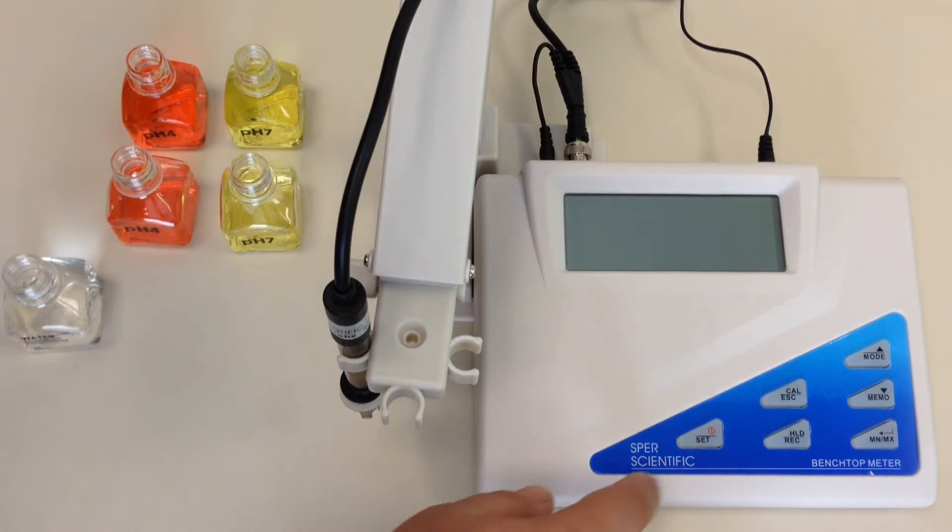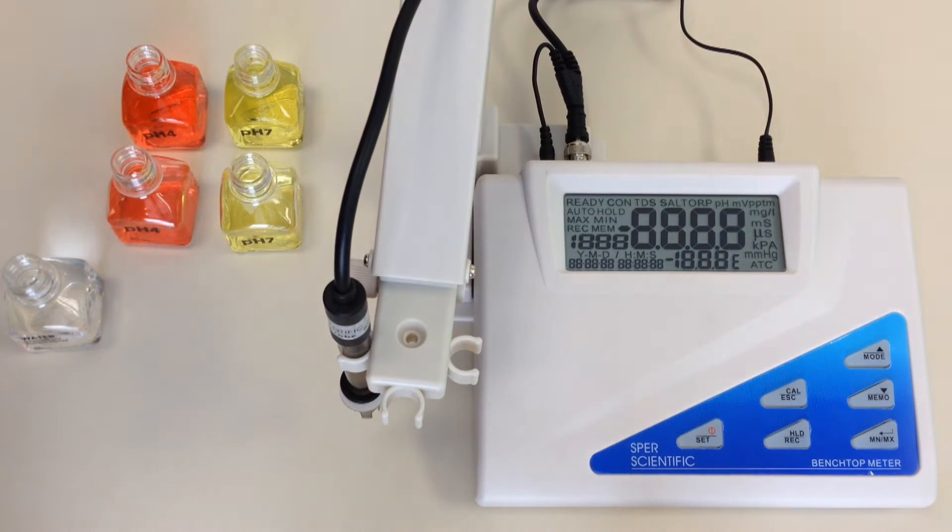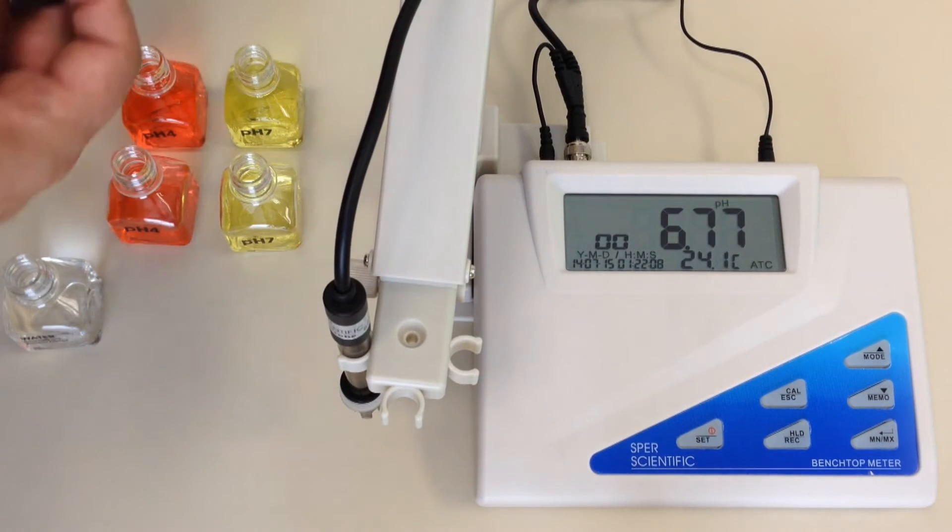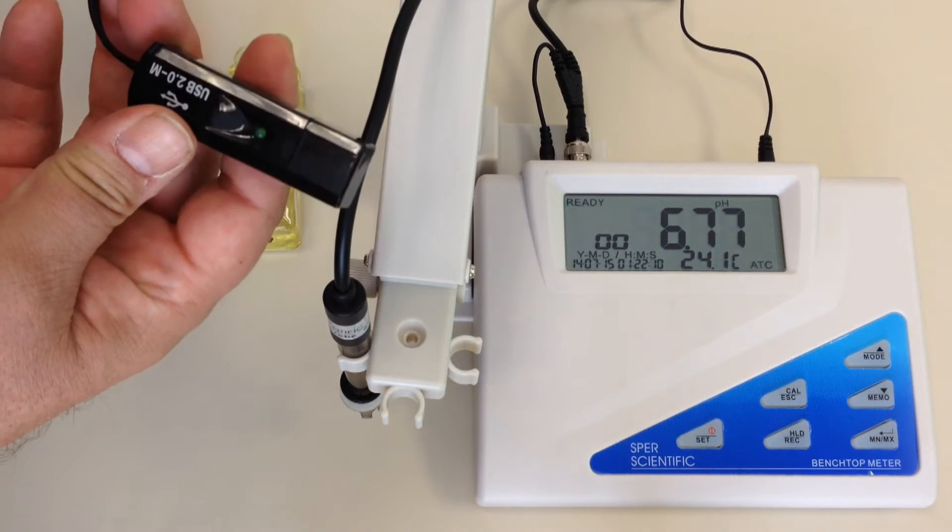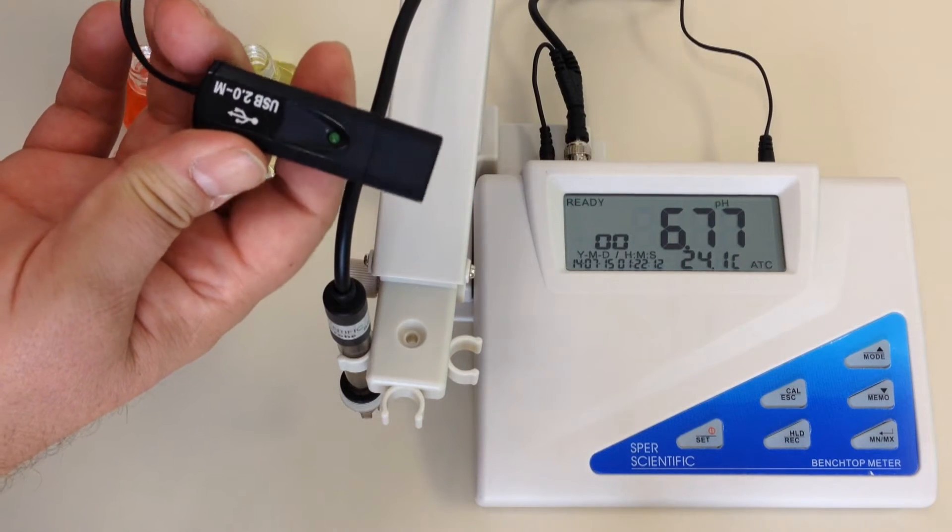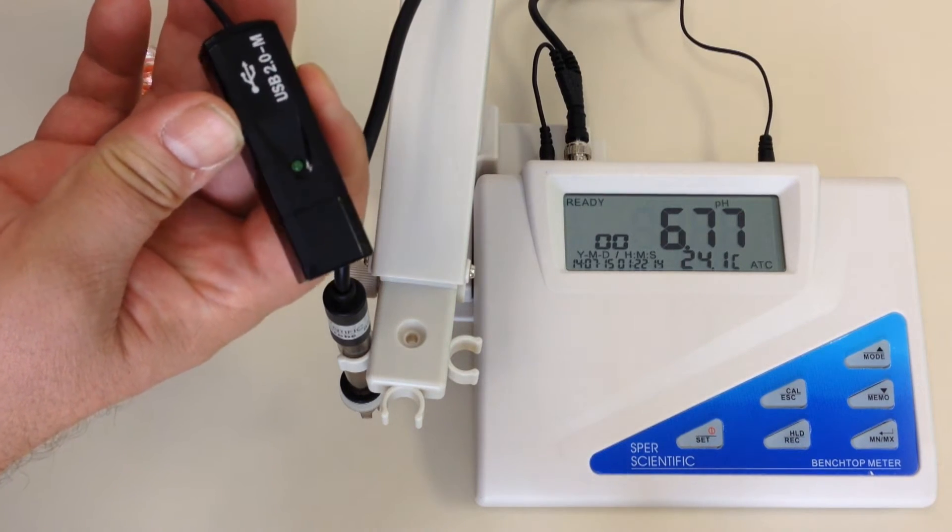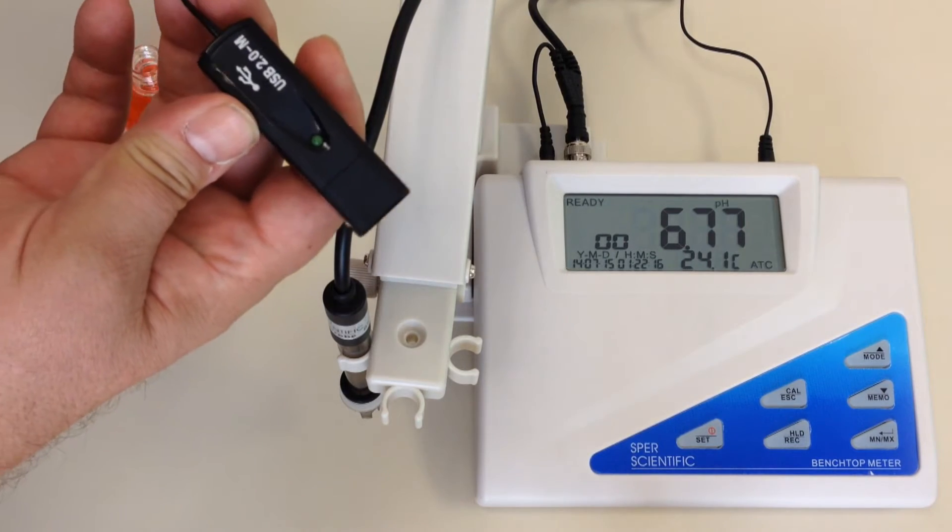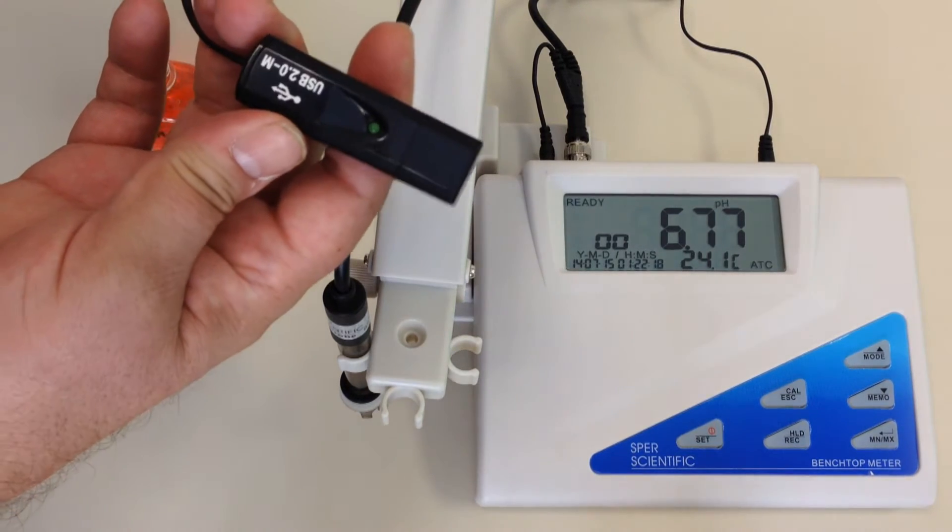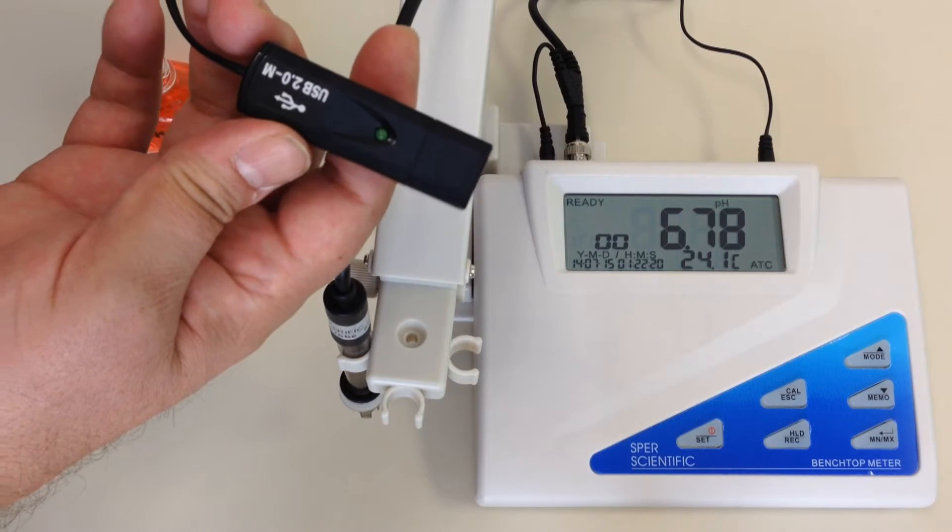Now, of course, the first thing you would always have to do is make sure the unit is plugged in and turned on. One of the nice features of this particular benchtop meter is the ability to connect to your computer using a very simple USB port and connection. It comes with the software and everything that you need to do to connect this benchtop meter to your computer.